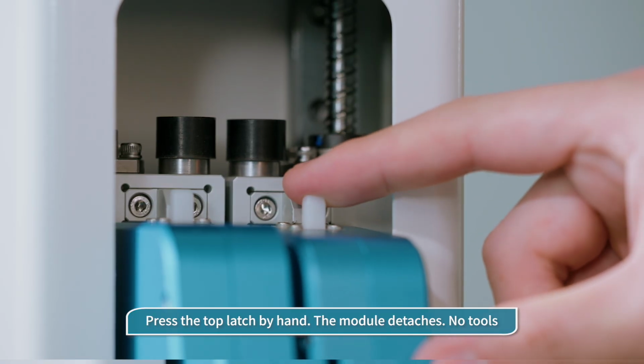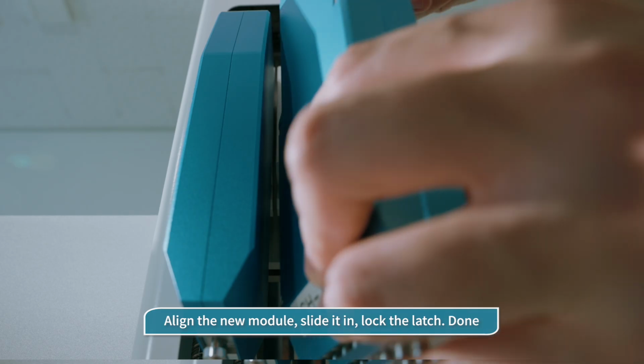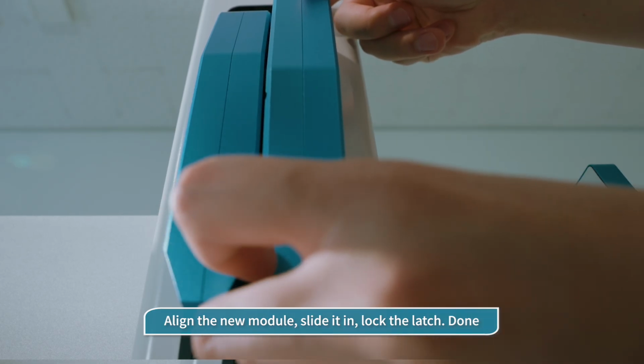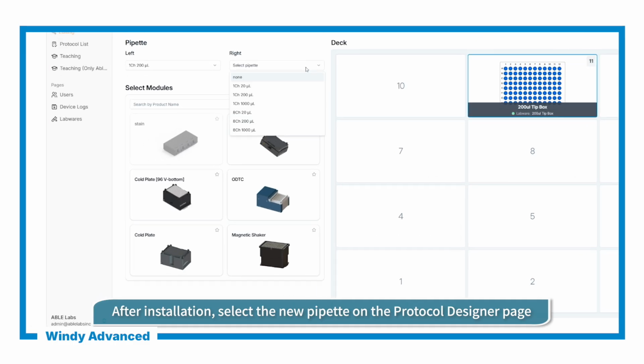The key to replacement is the top latch. Detach and attach by hand. No tools required. Once mounted, select the new pipette on the Protocol Designer page.